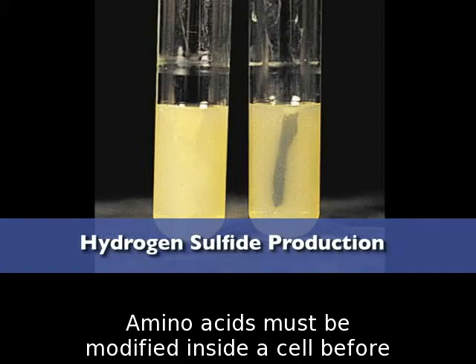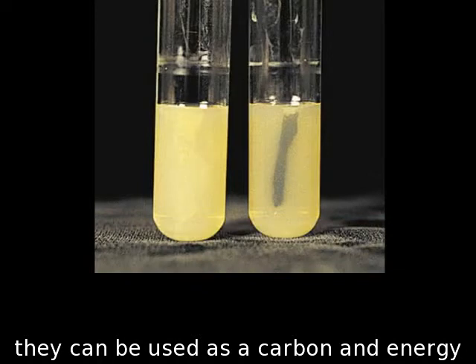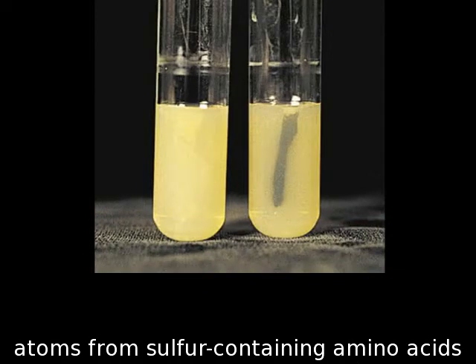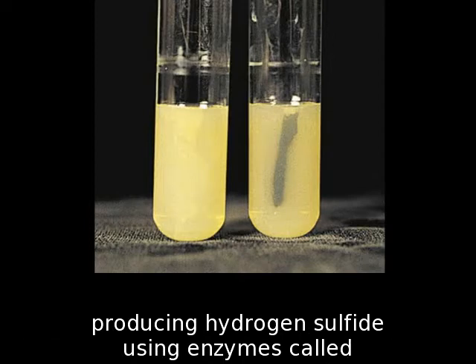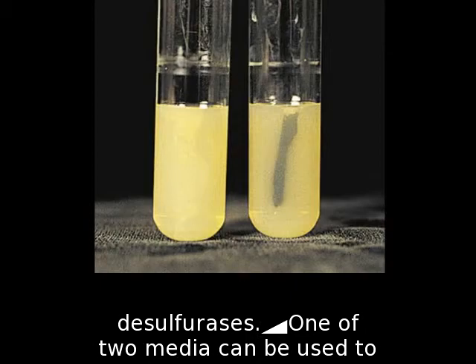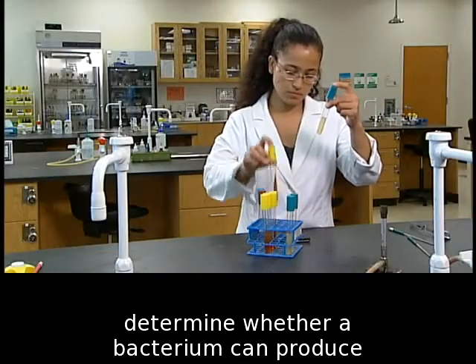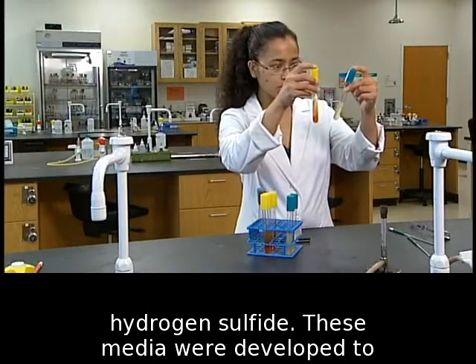Amino acids must be modified inside a cell before they can be used as a carbon and energy source. Some bacteria can remove the sulfur atoms from sulfur-containing amino acids, producing hydrogen sulfide, using enzymes called desulfurases. One of two media can be used to determine whether a bacterium can produce hydrogen sulfide.